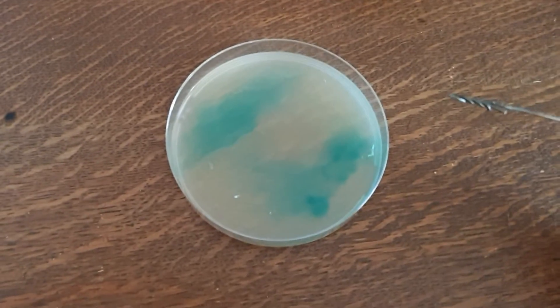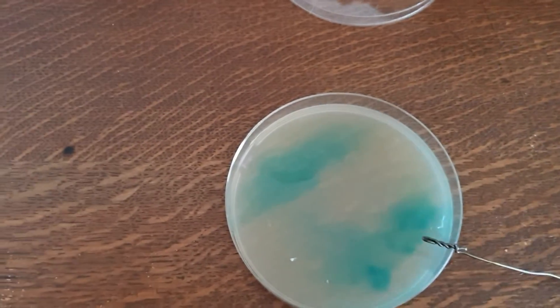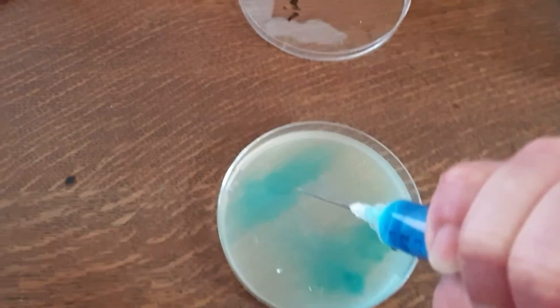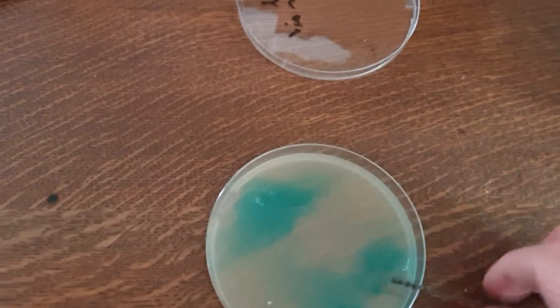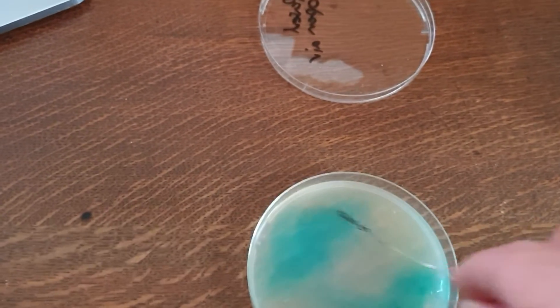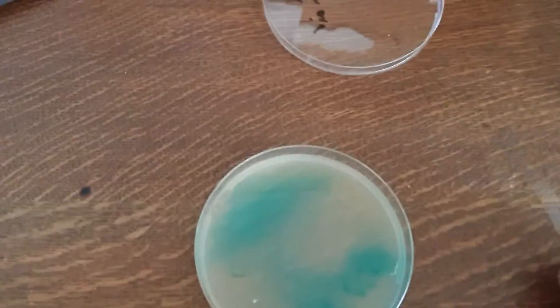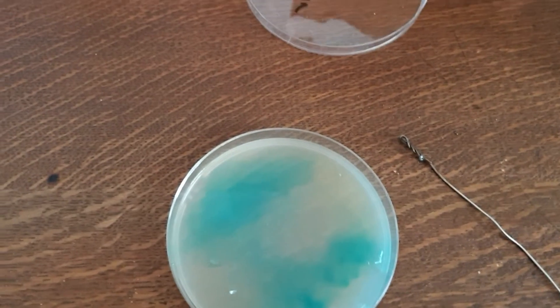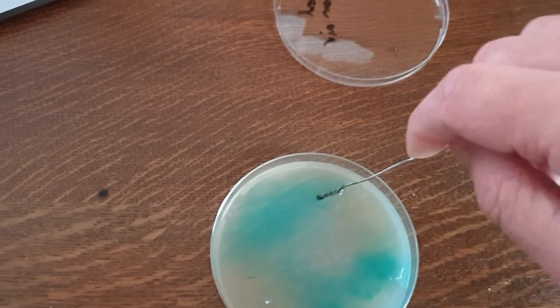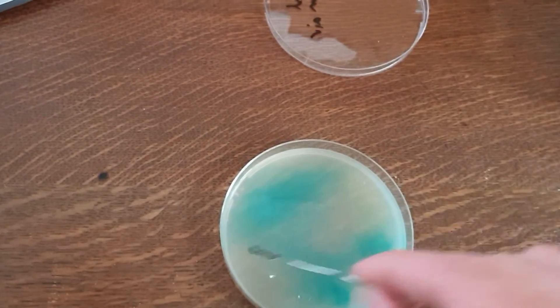I hope that helps — that is pretty much the reason why you streak. If you had a very clean spore solution and weren't really worried about bacteria, maybe you could put a little drop at the top and just wanted to separate the spores, and drag it all through. But if that was contaminated with any kind of bacteria or mold, it would be very hard to tell the difference. The correct way, the way I was taught at university, is to take it down the edges, take it down the side, push it up — it gradually thins out the solution.